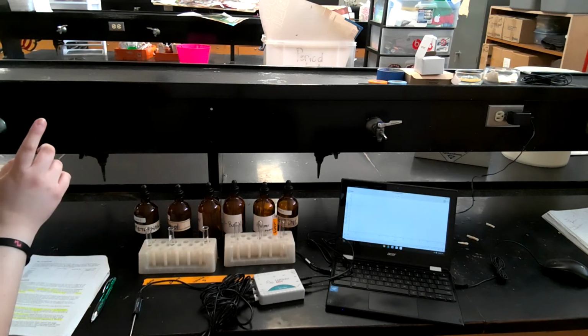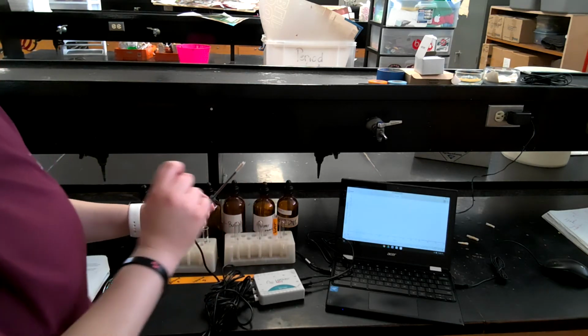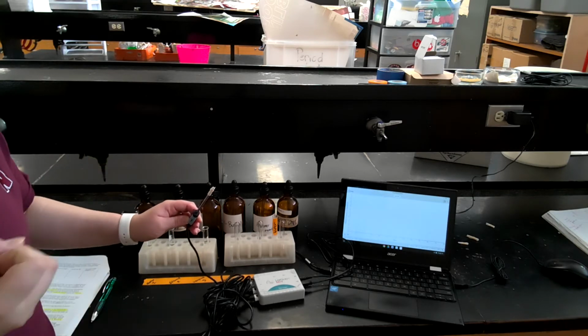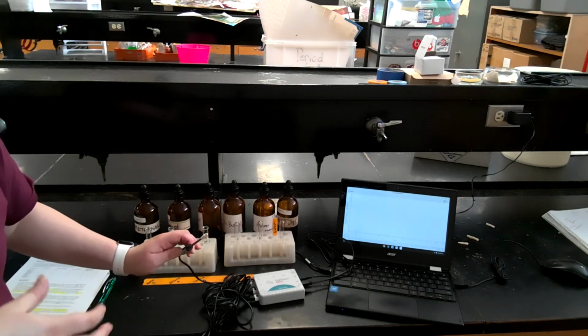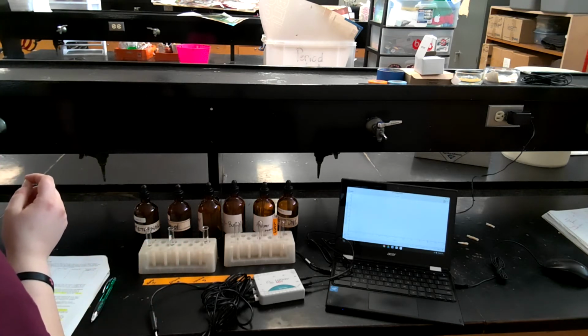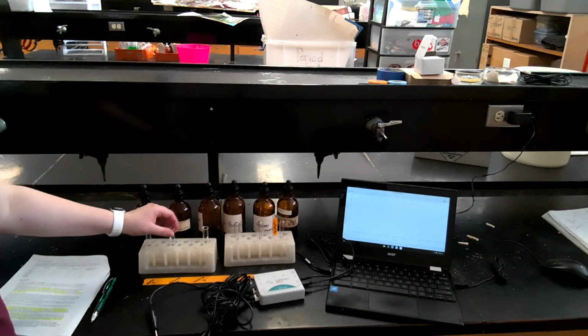And then step 3, I've already done that, where I've taken the probes and secured filter paper to the very bottom with a rubber band. The reason we use filter paper is so that it soaks up the alcohol, and then when we remove it from the test tube, the alcohol is still present and it'll still record how much is evaporating over the course of 4 minutes. And now I've already added the alcohols into each of the test tubes.